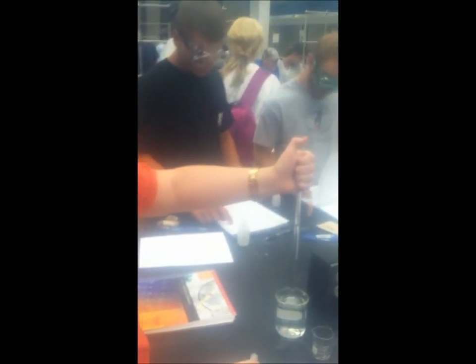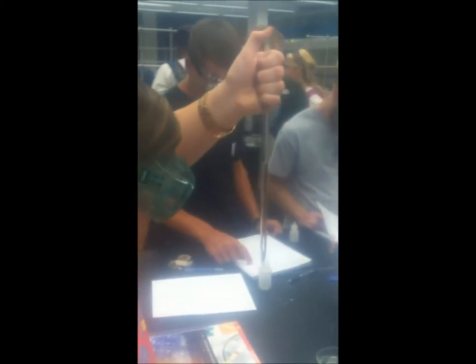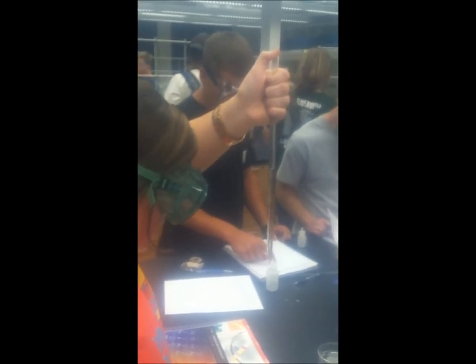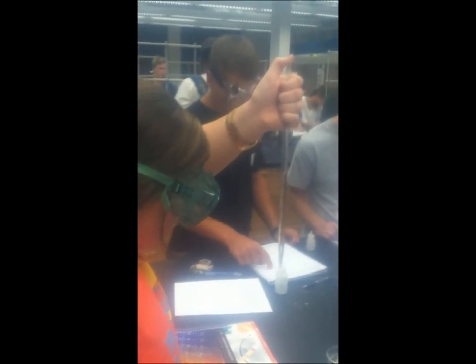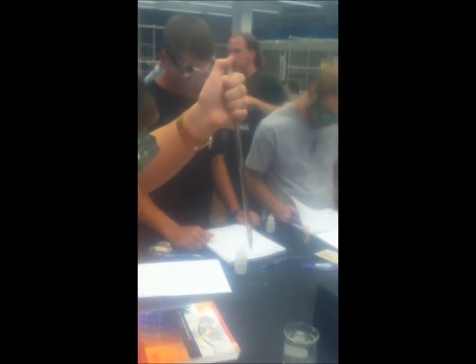Up next we have Carly, and as you can see once again, the first thing she will do is draw an unknown amount of water into her pipette and then measure from the bottom of the meniscus and record her data in the initial volume section of her chart.